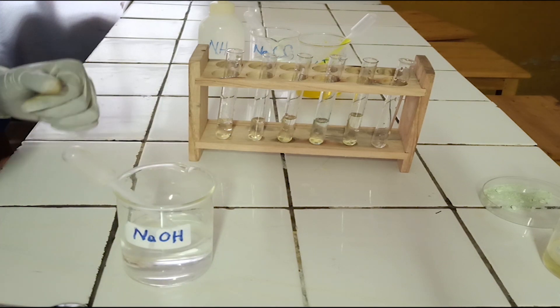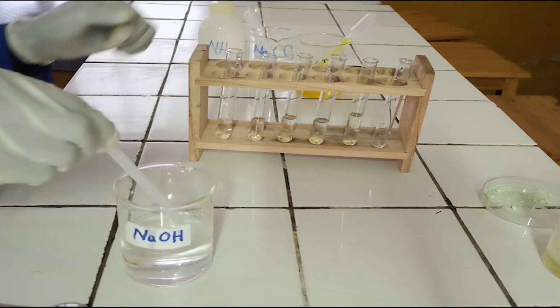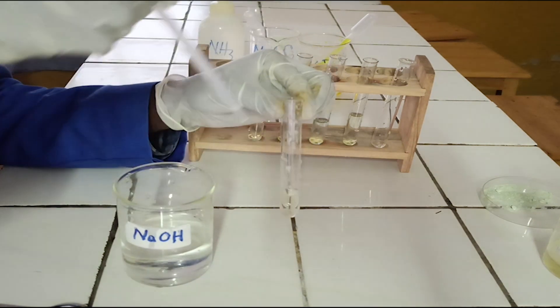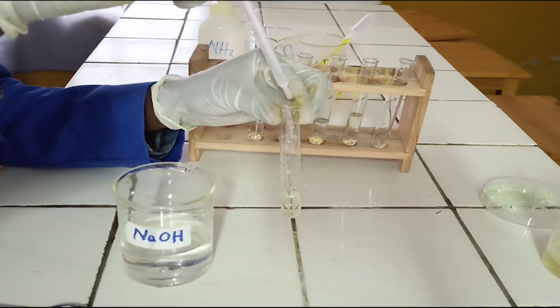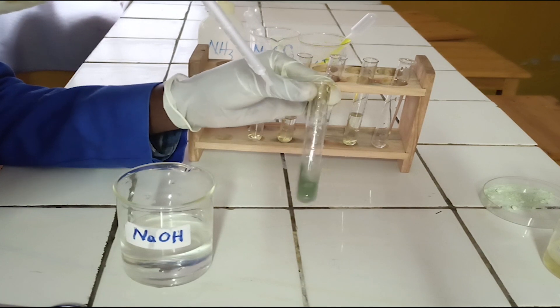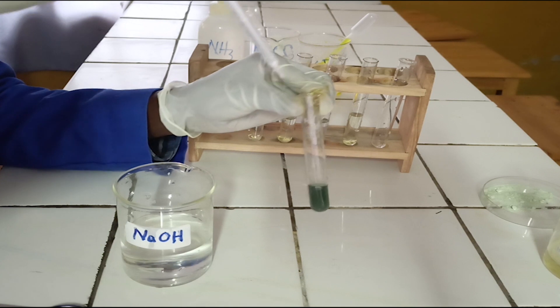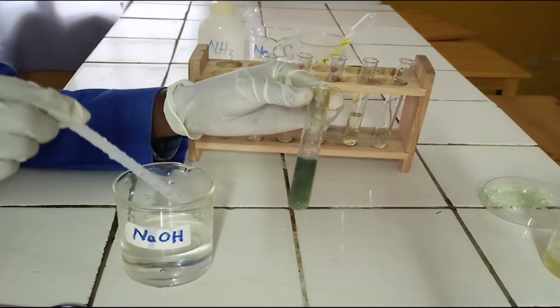Preliminary tests. To the first test tube, add sodium hydroxide solution dropwise until in excess. As you see, sodium hydroxide reacts with iron(II) ion to form a green precipitate, which is insoluble in excess sodium hydroxide.